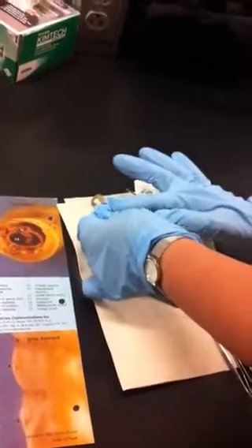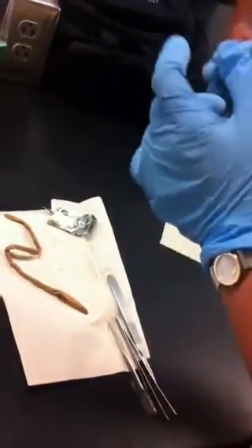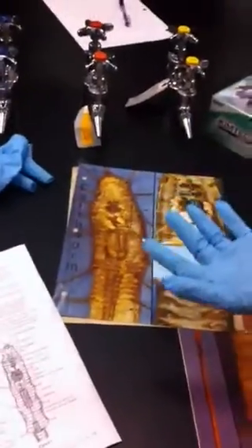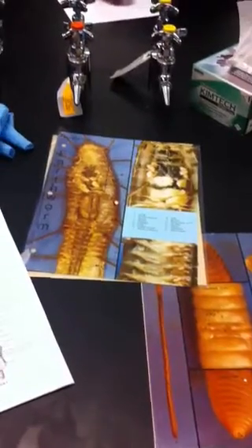This one, they're really segmented because they literally have muscle. So you now have a muscular system. They now use hydrostatic again, so they went back from having an exoskeleton go back. But in this case, though, because they're in land, not in water, right, they have to keep it from within. So this is the first time that you're actually going to be seeing a heart, and this is a closed circulatory system. So you do have the vein and the artery.